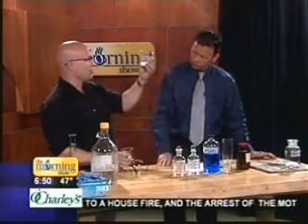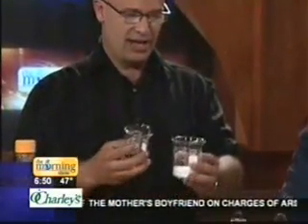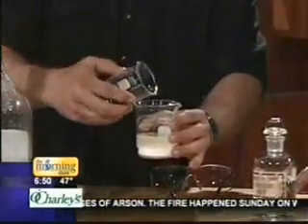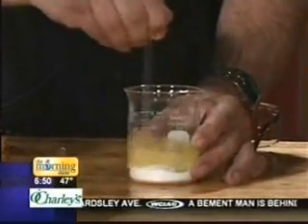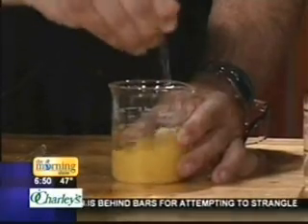What I have is just some regular table sugar, and this is some sulfuric acid. I'm going to mix these two together. Carbohydrates are called carbohydrates because they have water in them: hydroxyl groups located on the carbons, and they have a lot of water. This is going to take a little bit of time, so I'm going to move on to something else after I get it mixed up here.